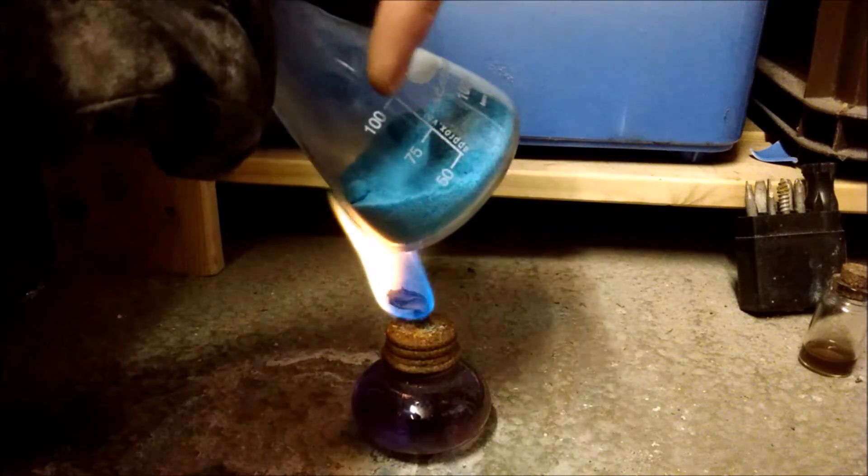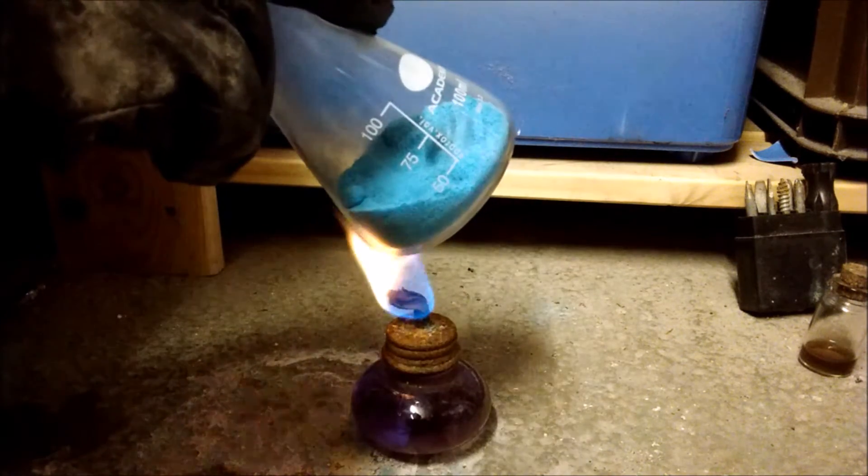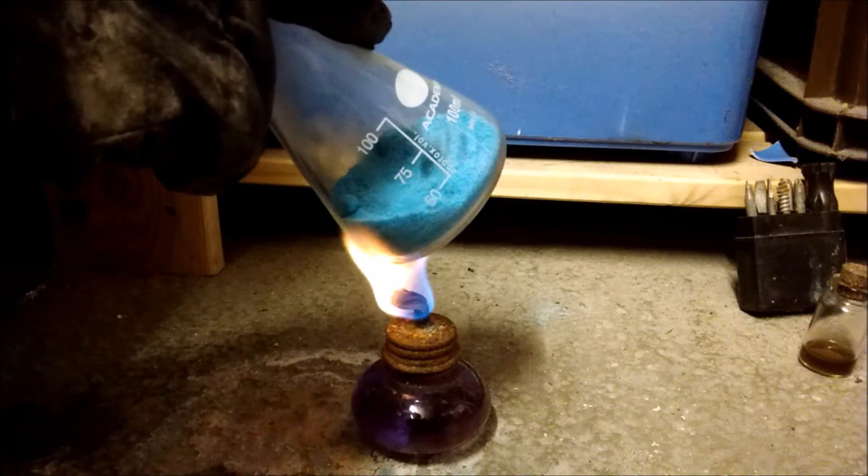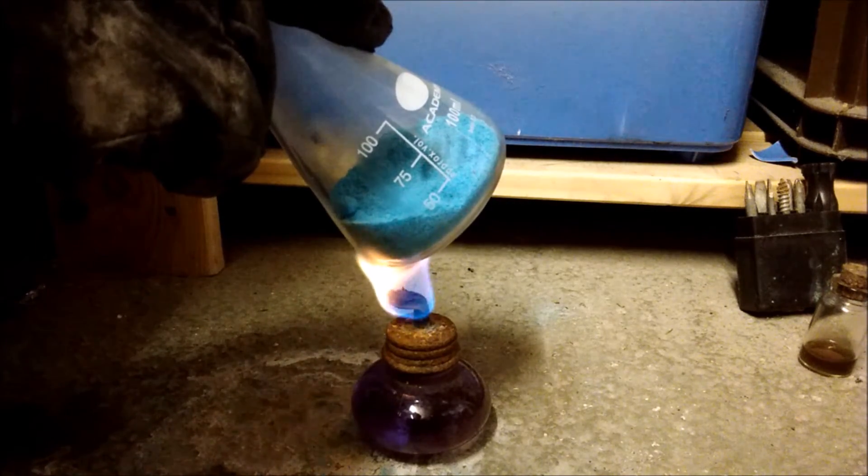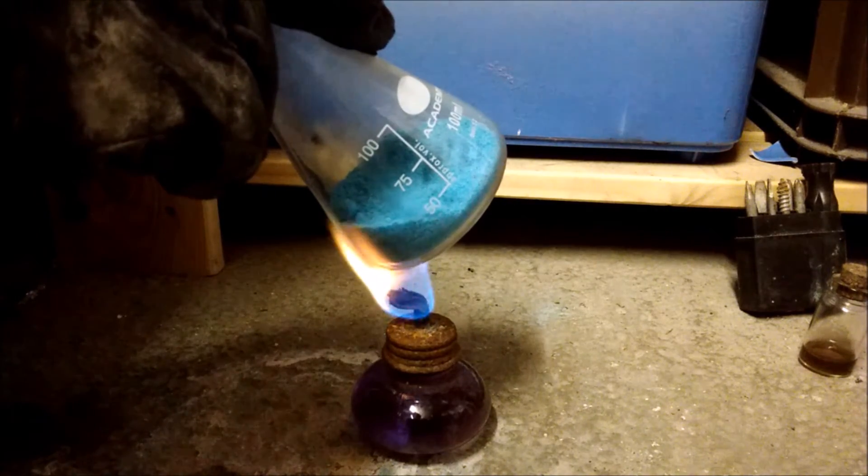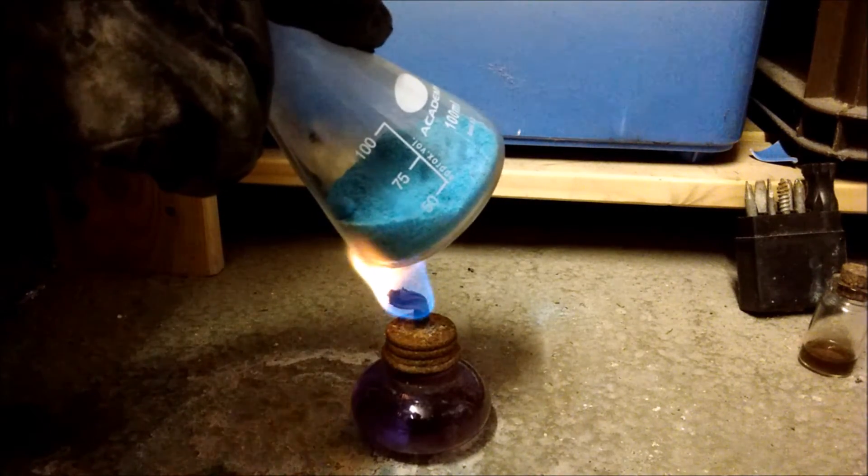And it should begin to turn white. It should also, you should see it clouding up along here, because the water that is being boiled out is being released. So, this is probably going to take quite a while, this amount of chemicals. So, I will cut back when it has finished.